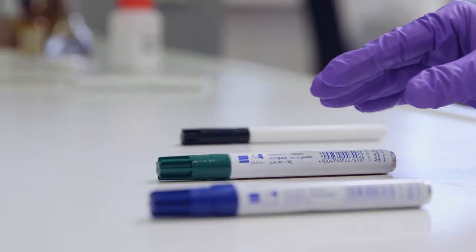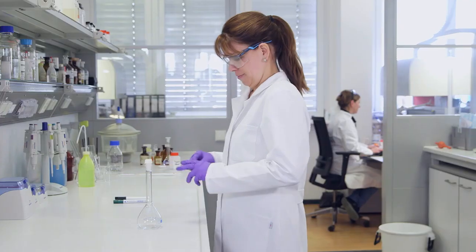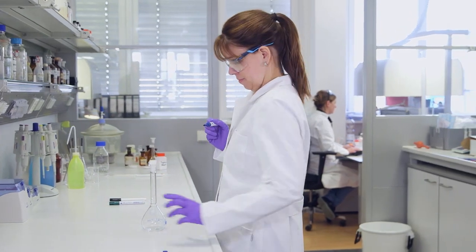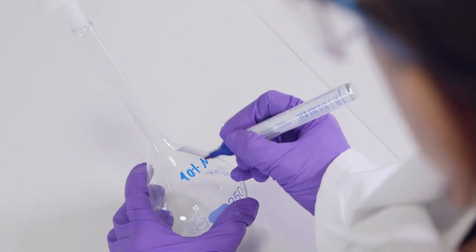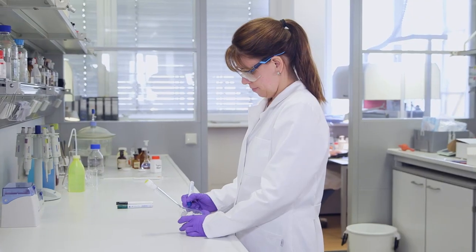First, in order to be able to remove markings better later, we recommend using blue or green markers instead of black ones, as experience has shown that these can be removed more easily.